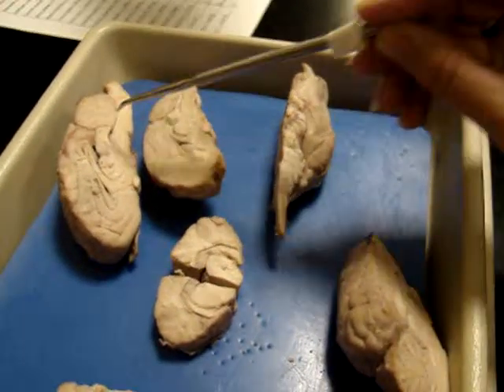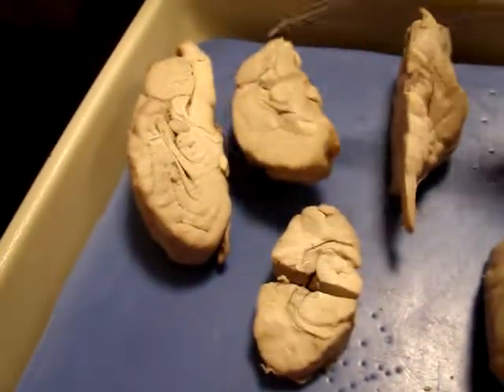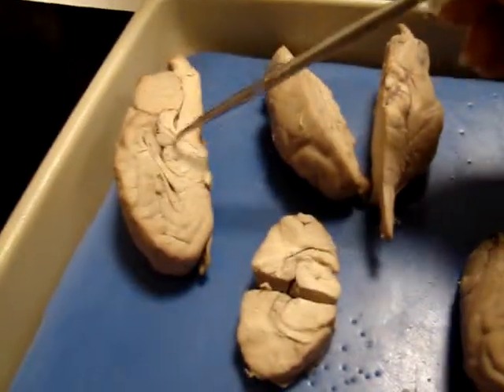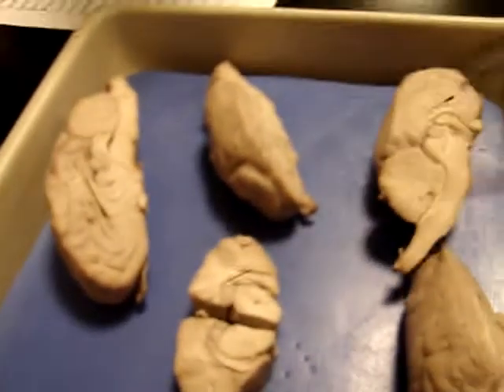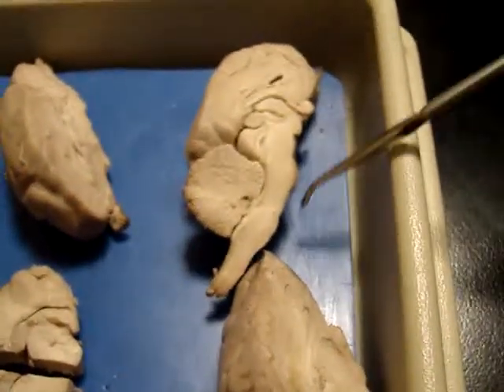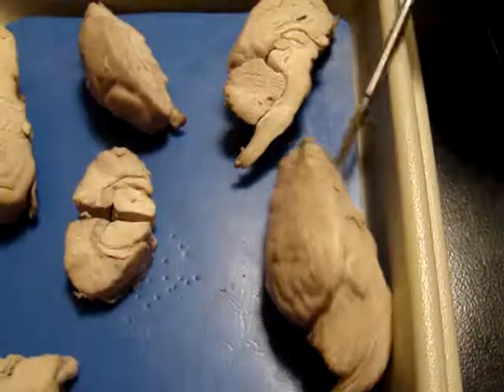And you guys got the pineal gland too, right here. Nice and dark. Are the cranial nerves really on the test? They're going to be in this section. When are we going to cover them? This week, I believe so. This one's not good, this is good for pineal gland. And this is good for lateral ventricle. This is a really good one. Helen pointed out the septum pellucidum is still on there. Awesome. Optic chiasm. They're going to be on, they should be on this test.